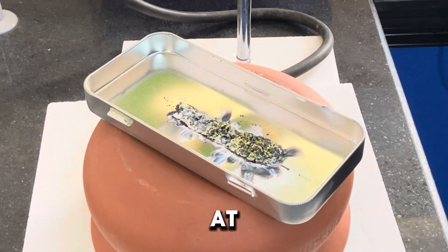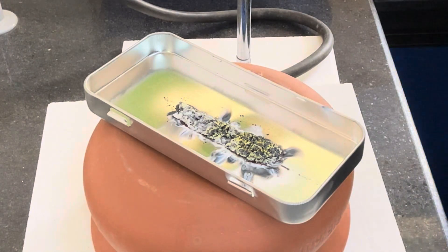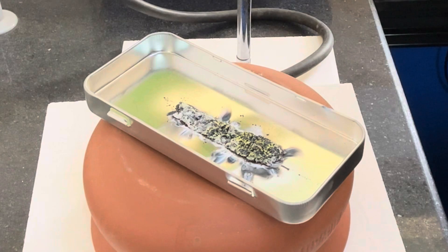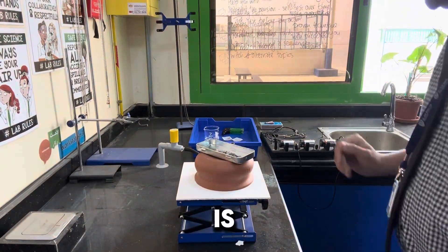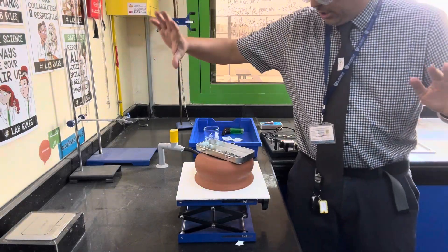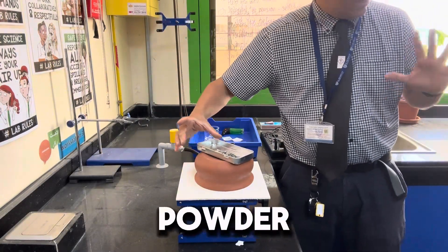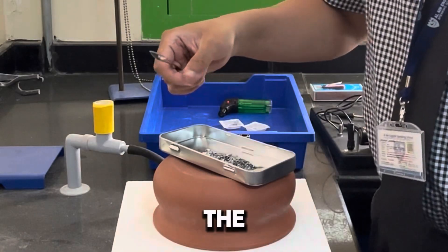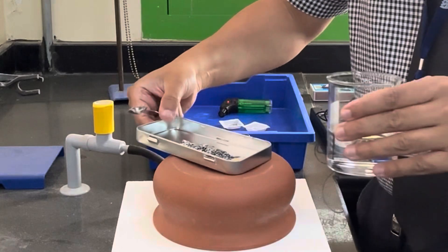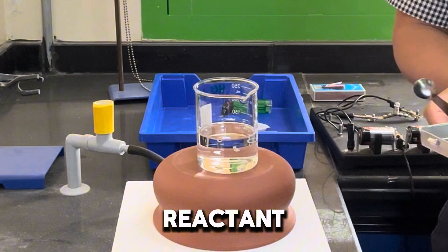We're going to have a look at what our product is. Come and have a look — don't touch it. Now what I'm going to do is transfer the powder into some acid. Transfer the powdery product and any unreacted reactant.